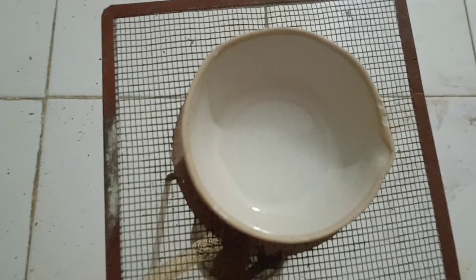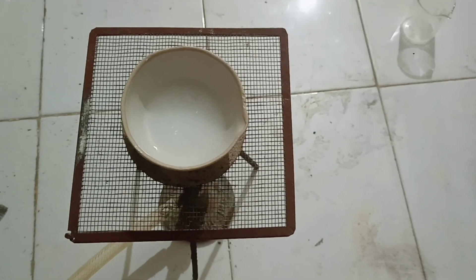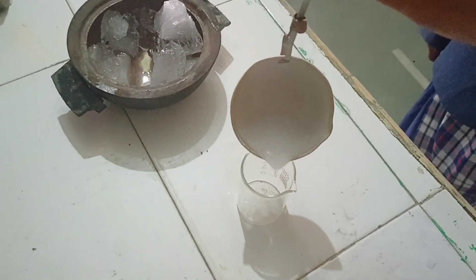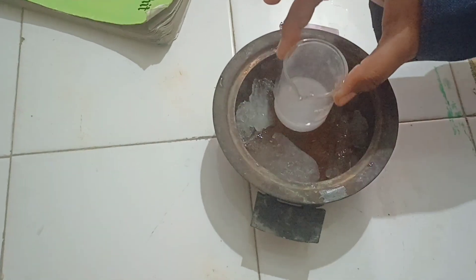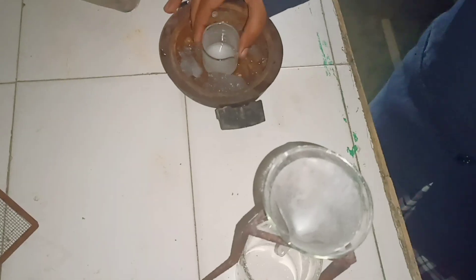After that, we will transfer it to a small beaker, and then we will put it in the water bath. It's the one-third part of the solution now. We will transfer it to the small beaker and put it in the ice bath to cool it down. Now the solution is cool. We will filter it with the help of filter paper.